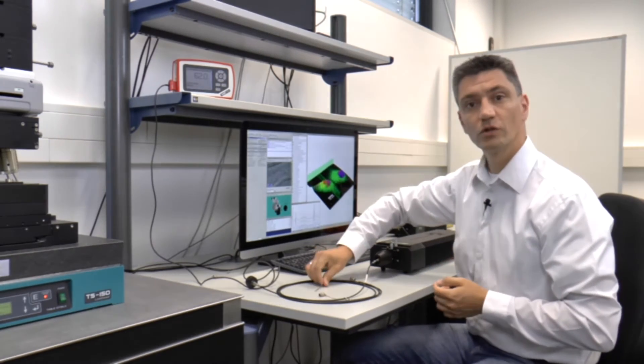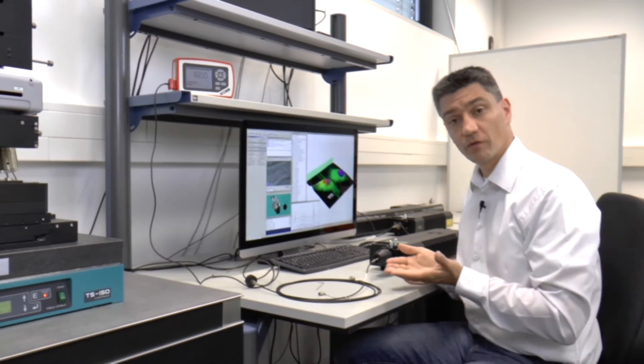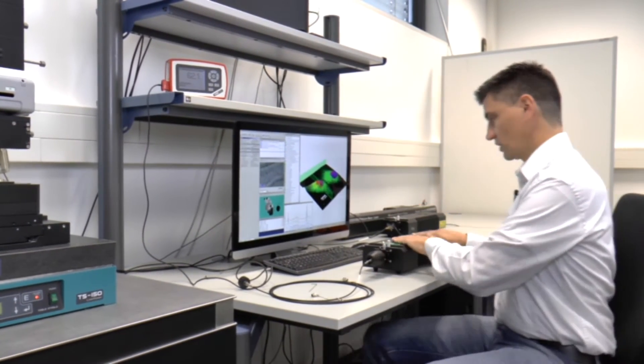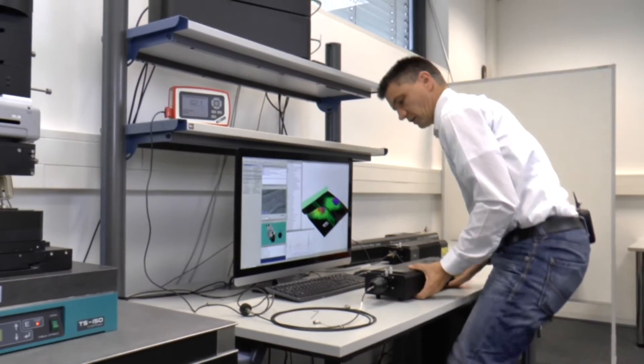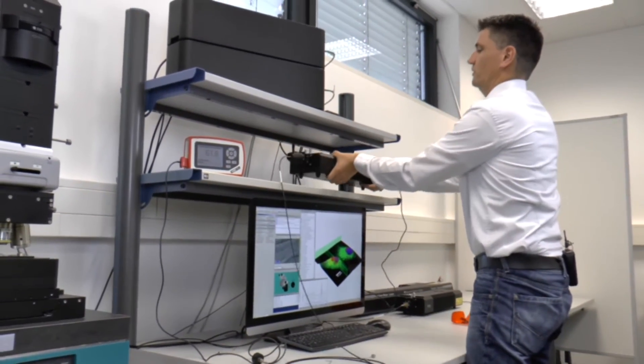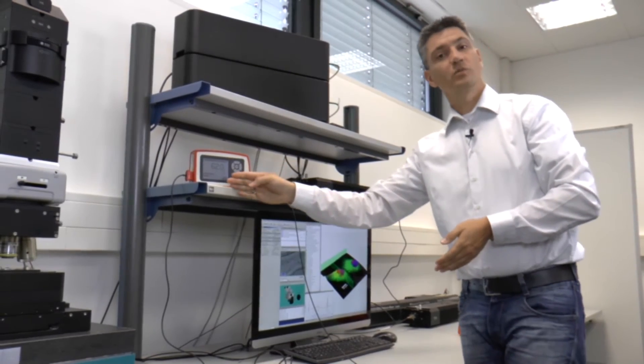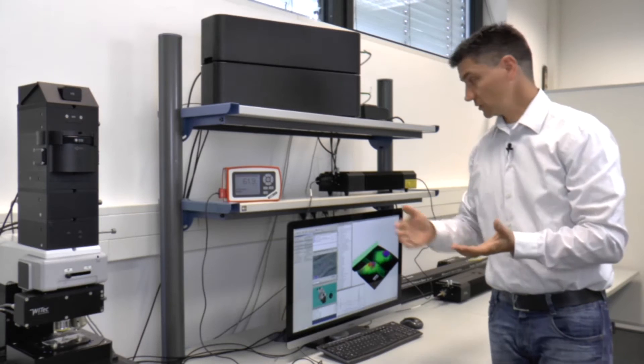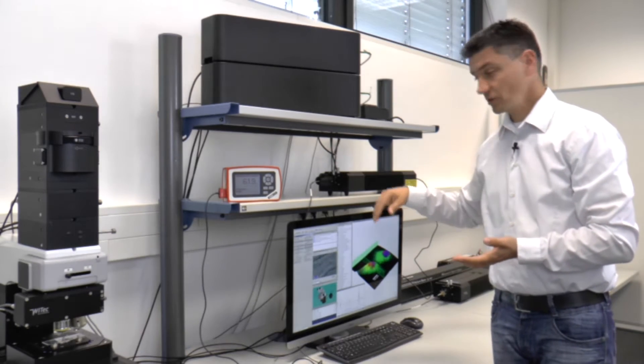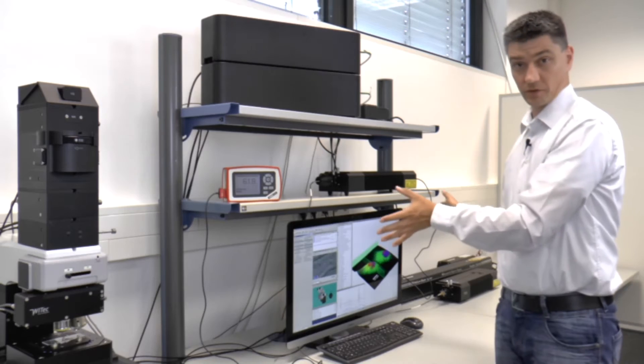In addition you can put your laser to whichever position you want to. So for example I can now take this laser and lift it up onto this shelf and you see we still got 62 milliwatts. With the laser sitting up here you never have to worry about it. You can open and close the laser shutter in here but otherwise you don't have to worry about it.